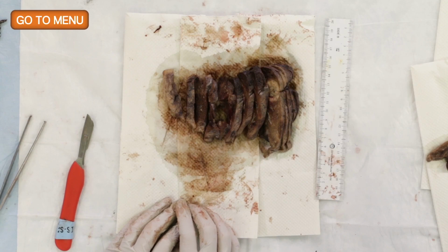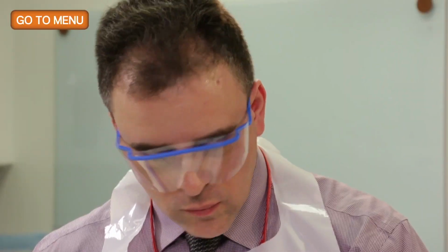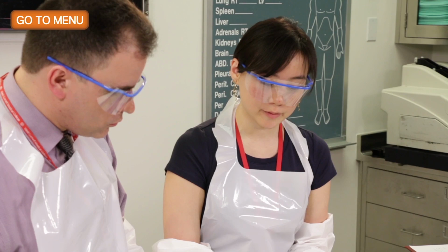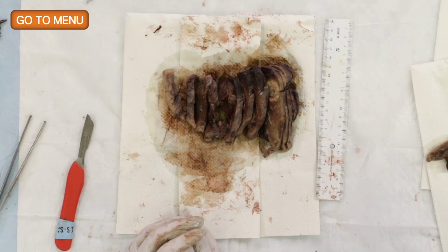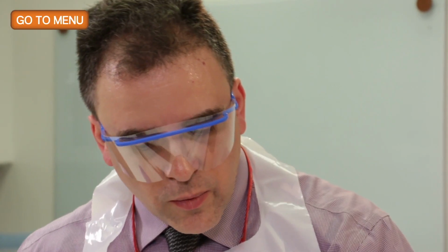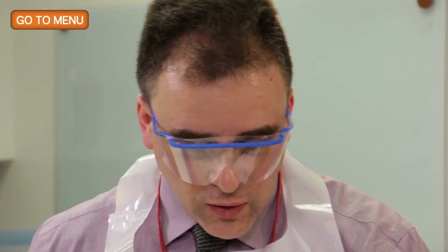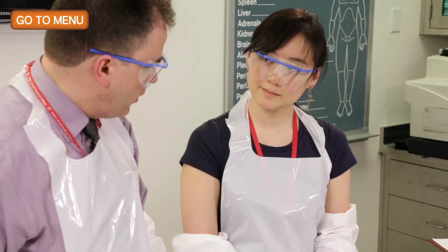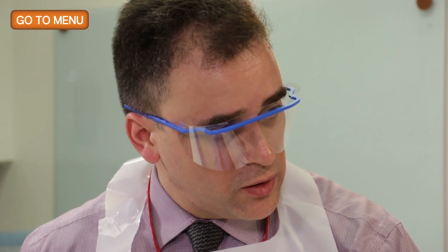Oh, Dr. Borzak, I do have a question. So in regards to submitting a normal lung parenchyma for this particular specimen, I understand that it's supposed to be distant from the tumor. However, because we additionally have other findings, where exactly is the best place to sample? We should take a minimum of 2 normal sections in our evaluation. It is difficult here because there is that other area of abnormality, which could be hemorrhage rather than something parenchymal lung disease. We didn't really find a lesion of fibrosis or emphysema to particularly sample.